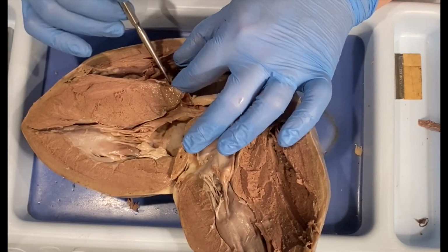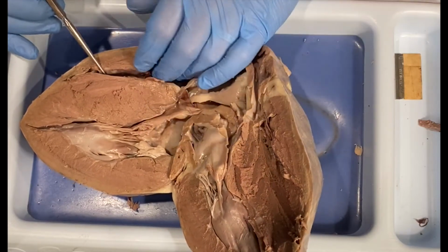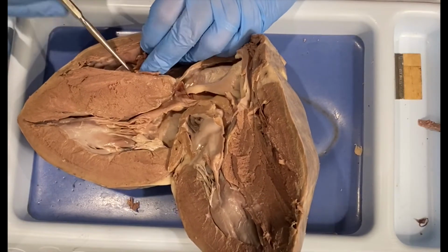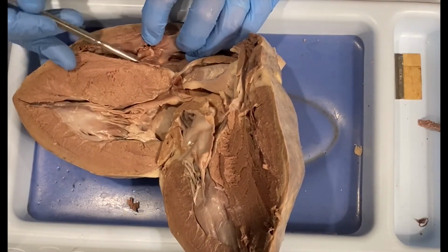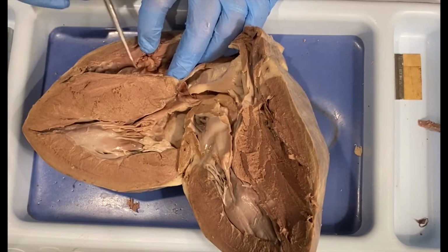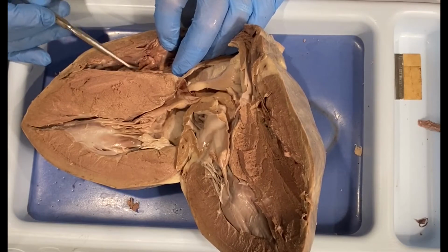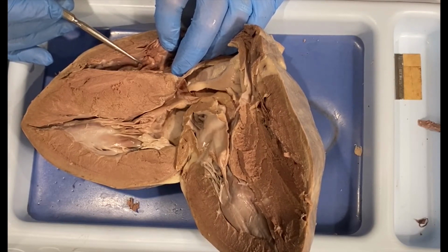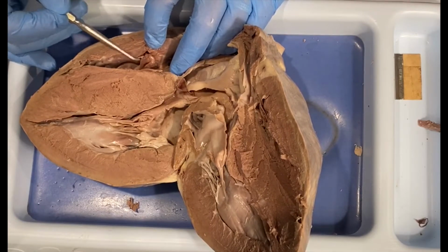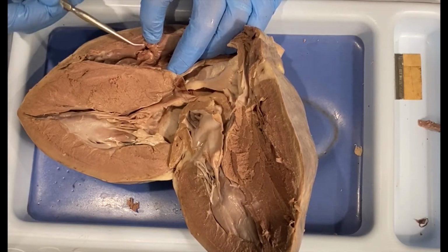So to get from the right atrium, when there is enough pressure, the blood starts to drain into the right ventricle. And when the pressure in the ventricle starts to build, it will not flow back into the atria because of this thing called a valve. Now, because this valve is between the atrium and the ventricle, the technical name for it is the right atrioventricular valve, or the right AV valve. And we also call this the tricuspid valve because these little flaps, there are technically 3 of them around this region.